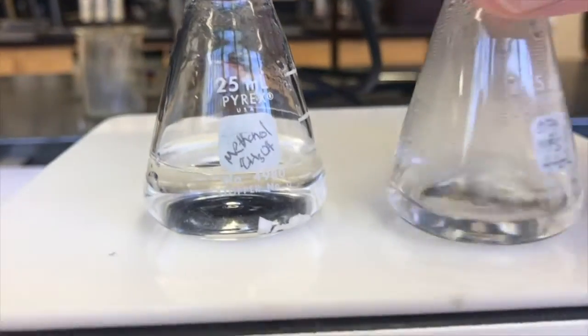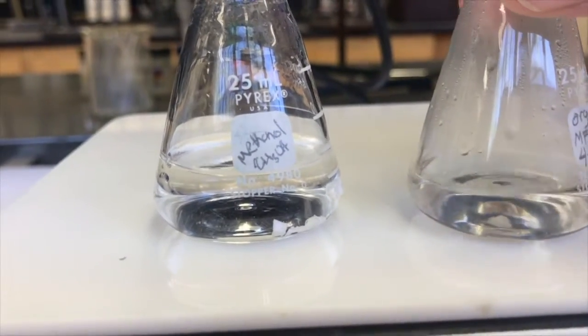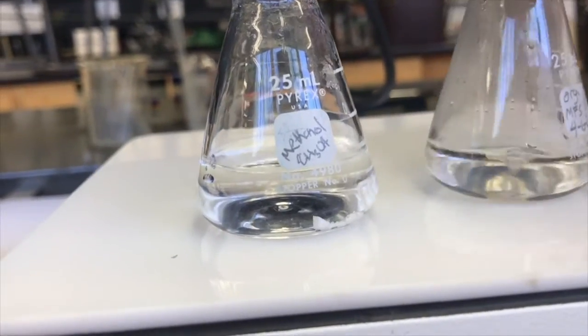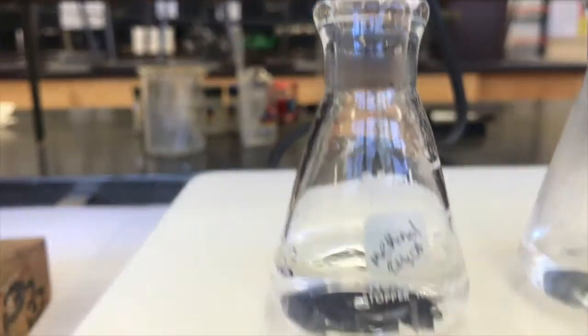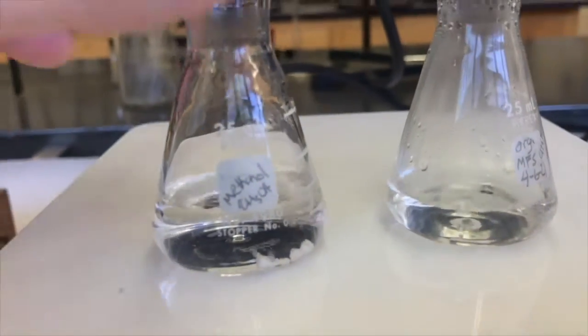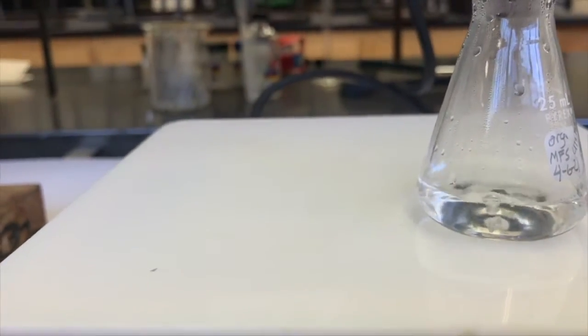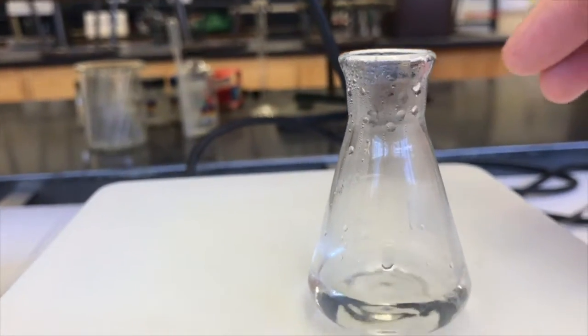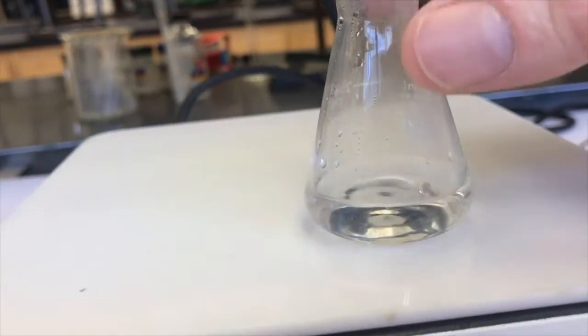So whoa, did we get there? I think we might be good, huh? I think it's all dissolved, yeah. Oh, good thing I didn't add any more. I could have been impatient and kept adding, but I didn't. I could take the methanol off, and now this one's boiling pretty good. It looks like it's all dissolved. I don't want to keep it on here too long now. Looks nice though, huh? Because it's going to constantly be evaporating some methanol.